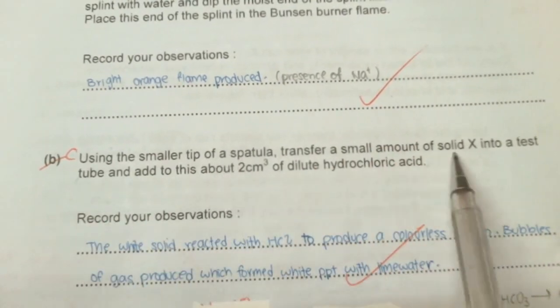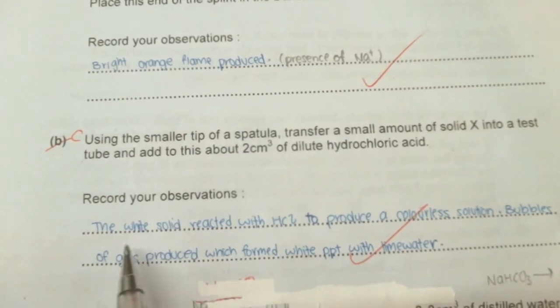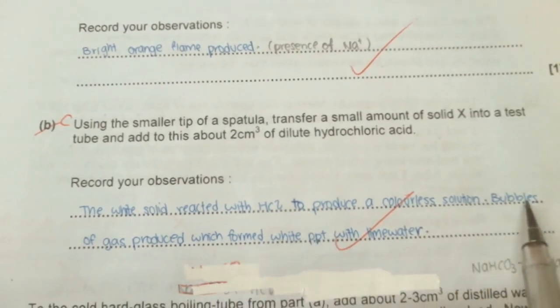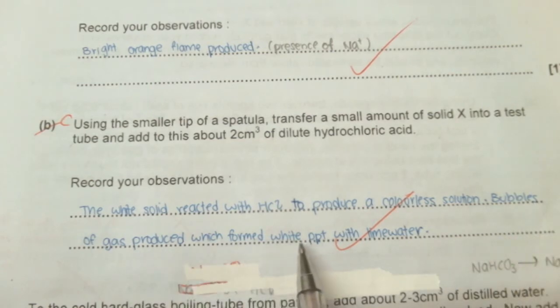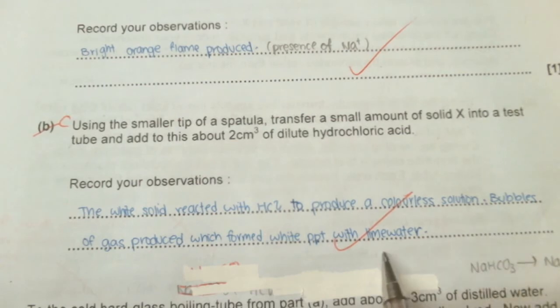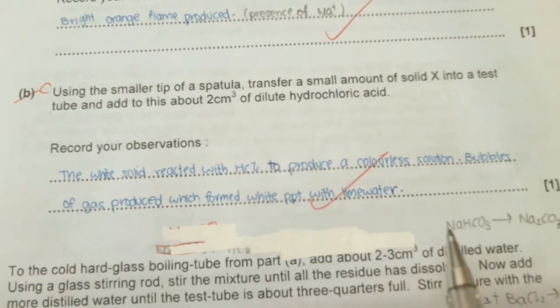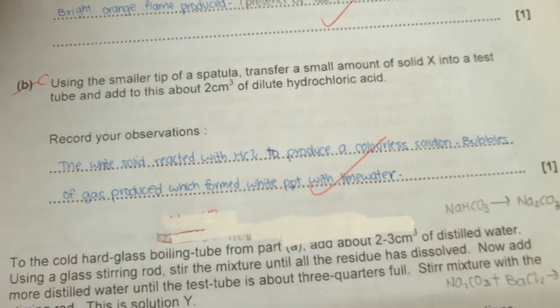In part C, you add acid to solid X. We observe that the white solid dissolves in HCl to produce a colorless solution. A very important observation here: bubbles of gas are produced, which turn lime water milky, forming a white precipitate. This is another confirmation test that solid X could be a carbonate or a bicarbonate.